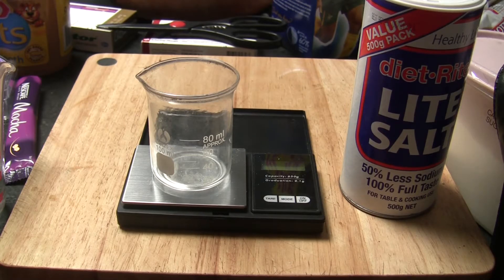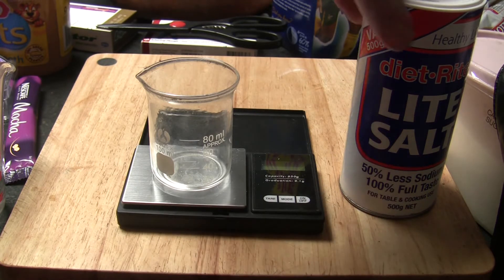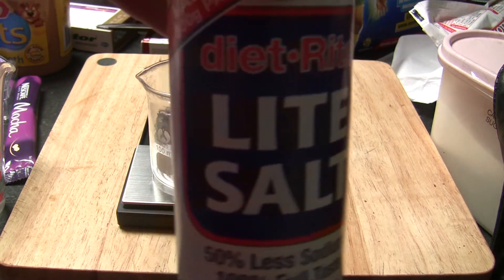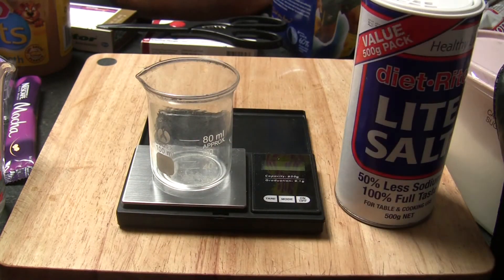Ok, so in this video I'll be showing you how to separate potassium chloride from sodium chloride from this light salt. You can buy this at any grocery store.